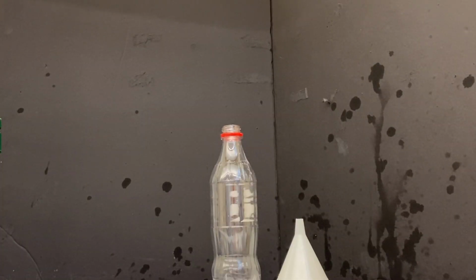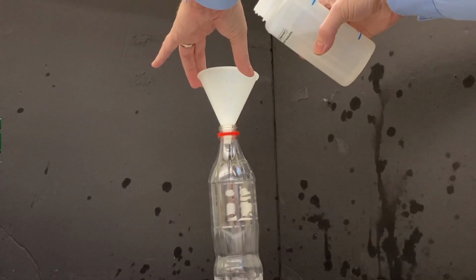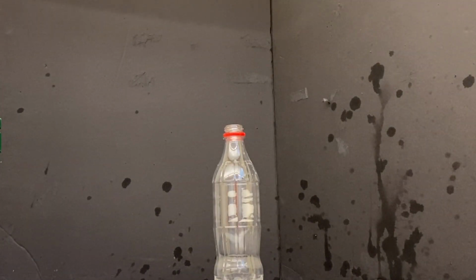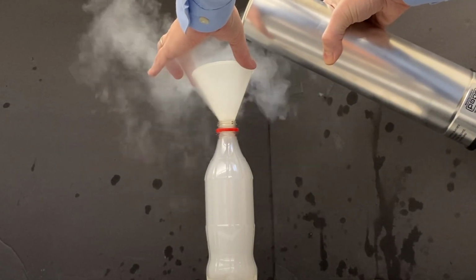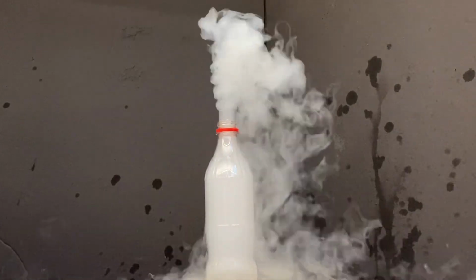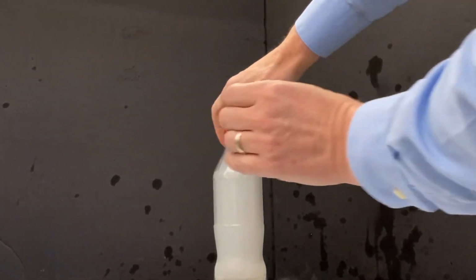Round number 2 uses a slightly more rigid plastic bottle. You may recognize the shape. It's a Coke bottle. Once again, I'm starting with the addition of a small amount of water in the Coke bottle, just to increase the dramatic effect. And just ignore the splashes on the backdrop from my first explosion. As I add the liquid nitrogen, remember that Coke is a fluid that is bottled under pressure. So this plastic bottle was designed to withstand much higher pressures than the water bottle was previously. Again, what you are seeing is water vapor rapidly condensing in the presence of the very cold liquid nitrogen.